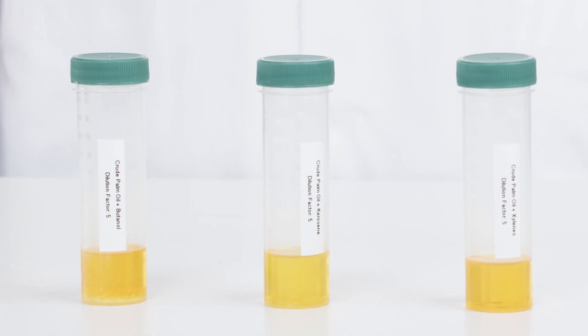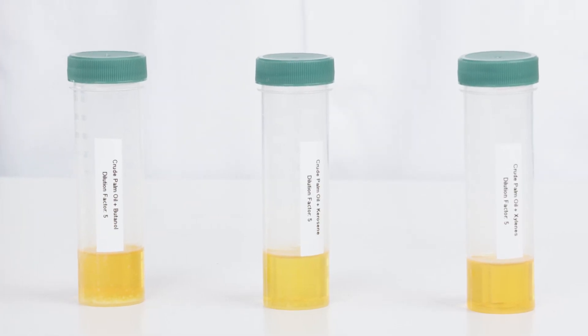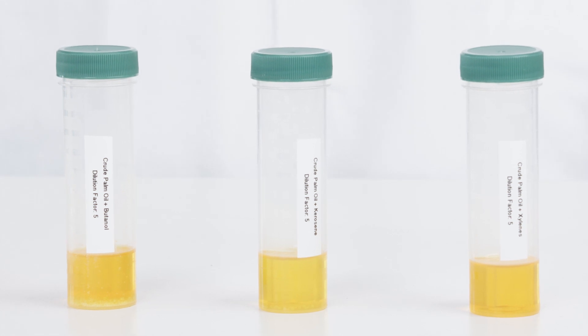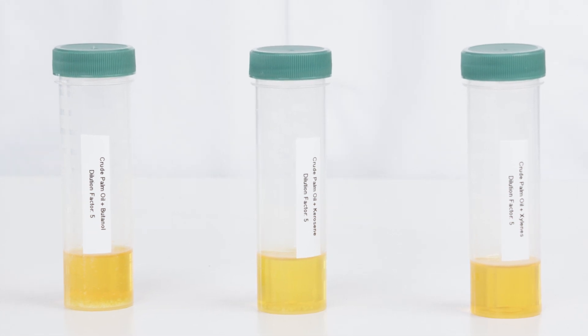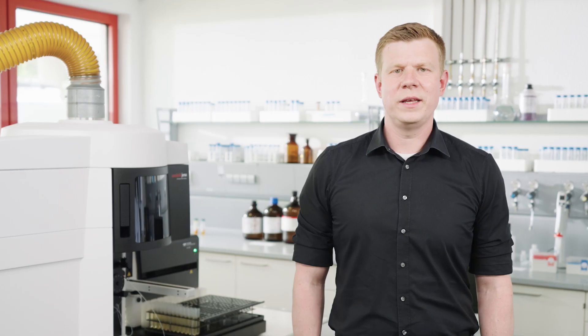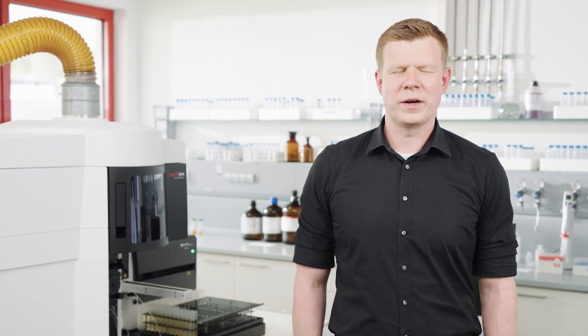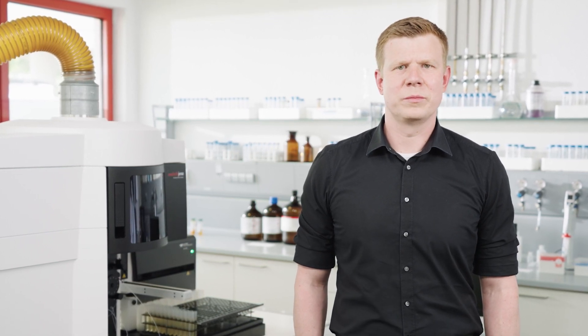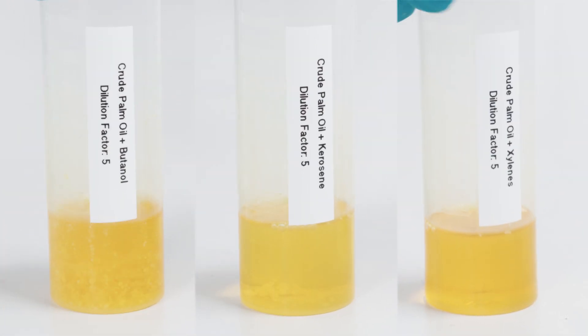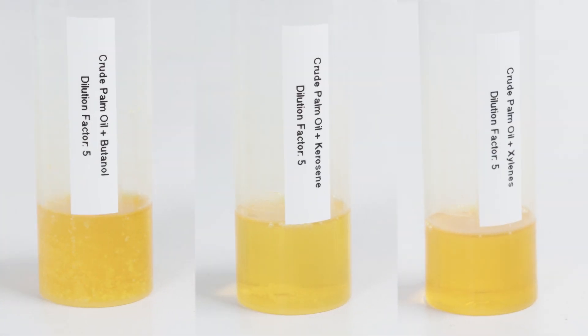Often several oil types or different processing stages have to be evaluated in one method, and therefore it's advised to find a common solvent, which can be easily found in a simple dilution test. Here you can see a 1 to 5 dilution of palm oil in butanol, kerosene, and xylene. This makes it very easy to decide which solvent and which dilution factor provides stable measurement solutions. In the case of palm oil, we will now work with a dilution in xylene.